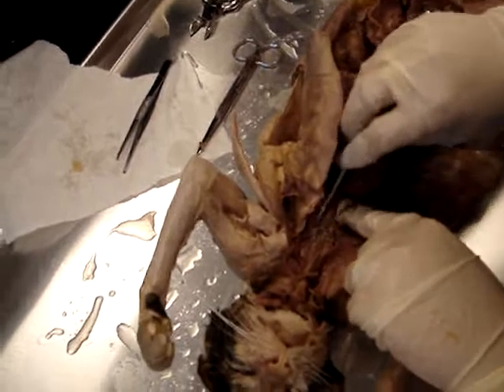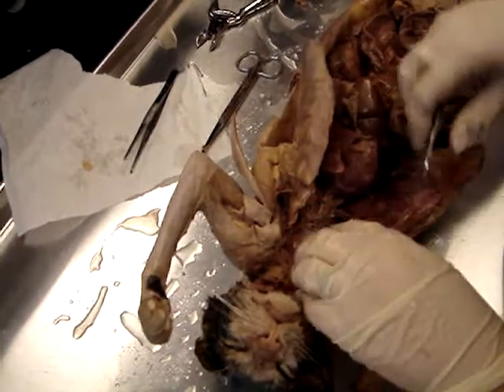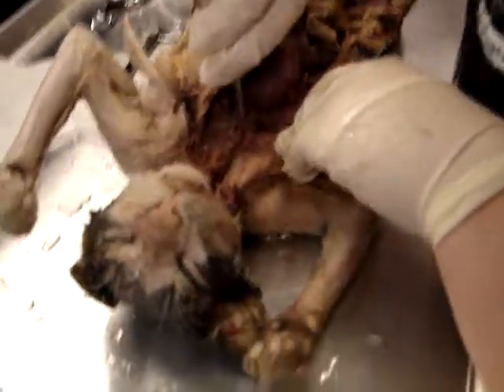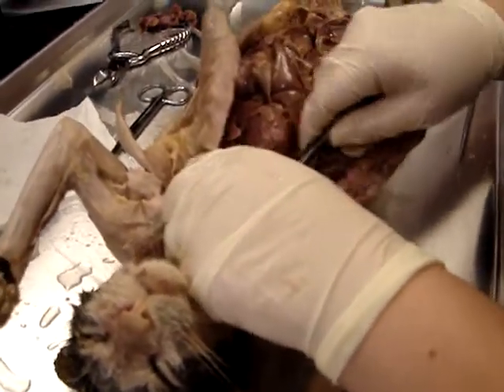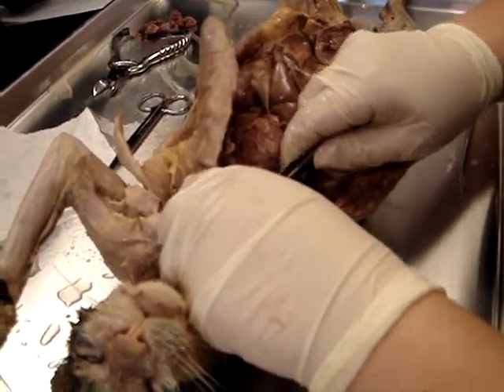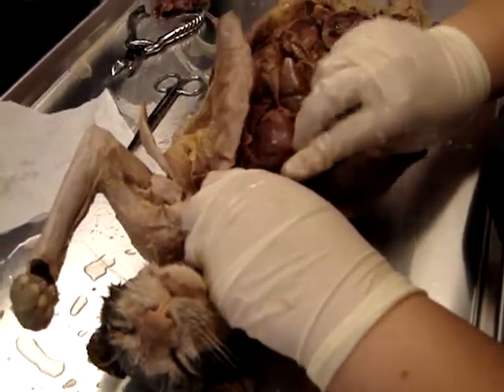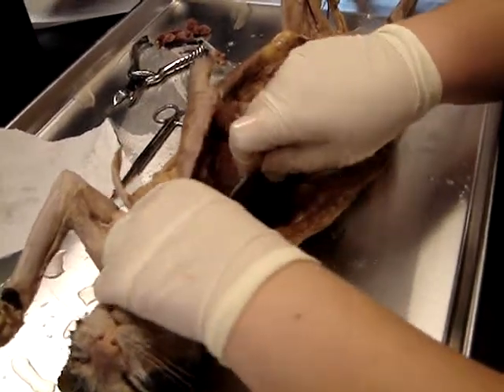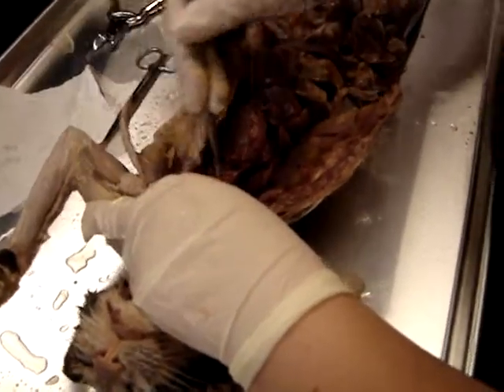So I'm trying to find the 3, and I don't see the 3rd. You see? Hold on, sorry. I'm trying to find the 3rd branch. Just a lot of... What if you cut the wrong one on accident? Don't cut any vessels. Okay? So I'm lifting up all this blue so we can see underneath. All right? And so our brachiocephalic artery splits into 3.